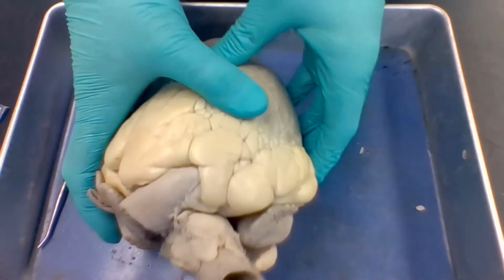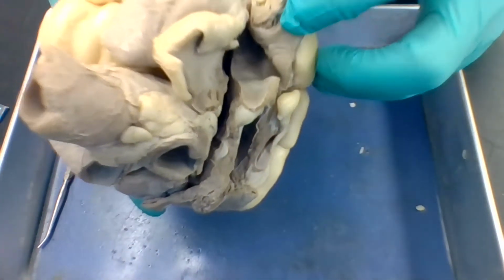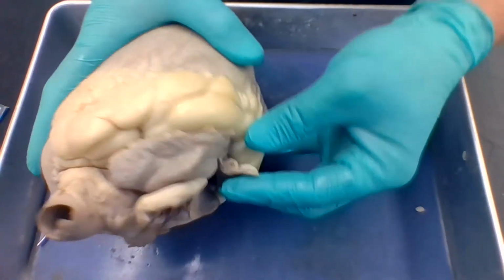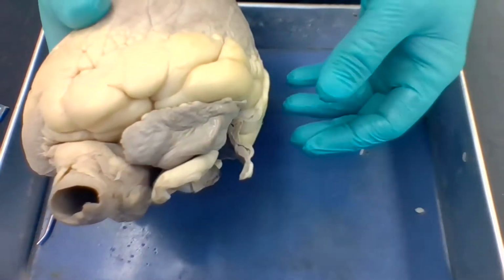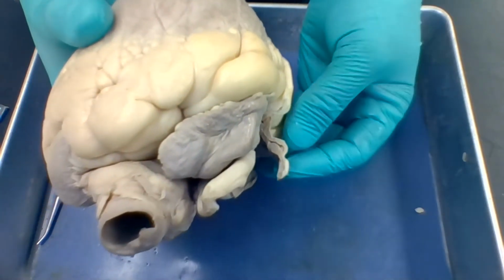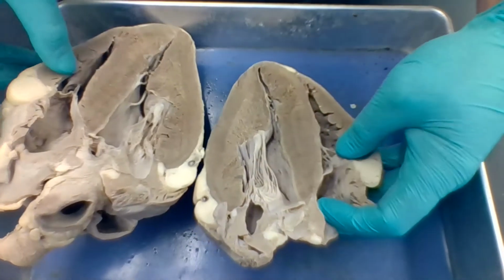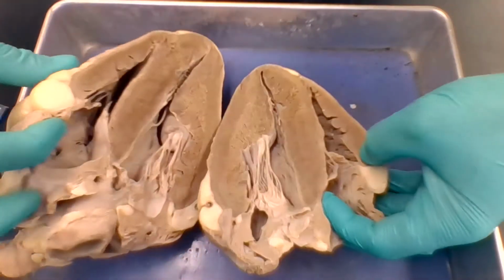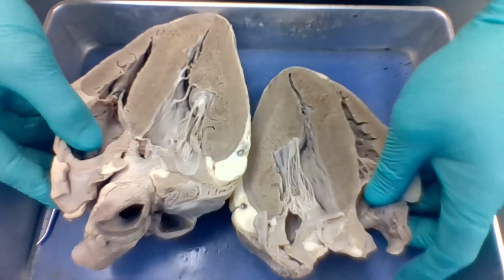So the heart sits in the body on the left-hand side. Blood returns from the body through the, cut off here, but through the inferior and superior vena cava. The superior vena cava is draining the head and the upper extremities, and the inferior vena cava is bringing blood from the lower body. And it's going to dump into this first chamber here, okay? Now remember, this is together, right? Cut it open, put it like this. And this first chamber, that's the right atrium.